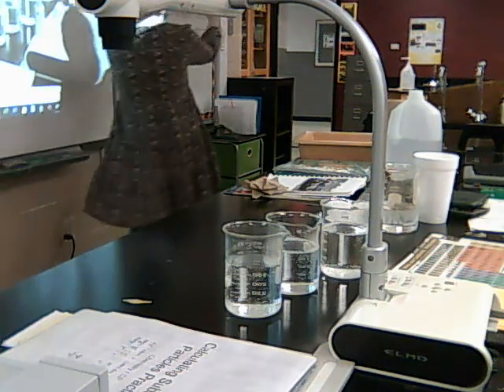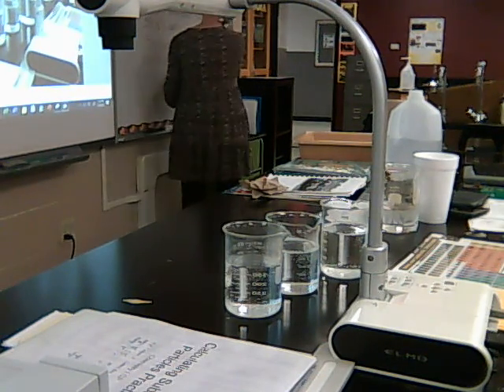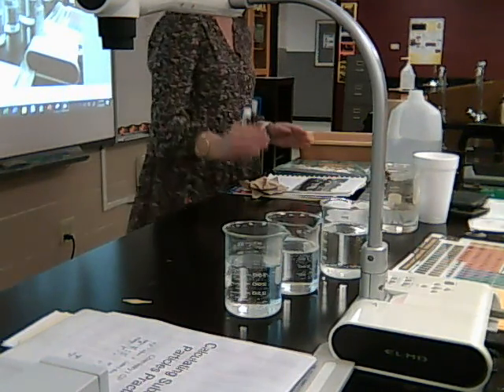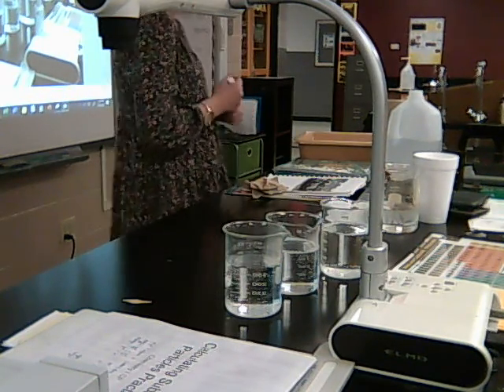Because I had two what? What are both of these? I changed them. What are they? Experiment. Which is the variable that we change?